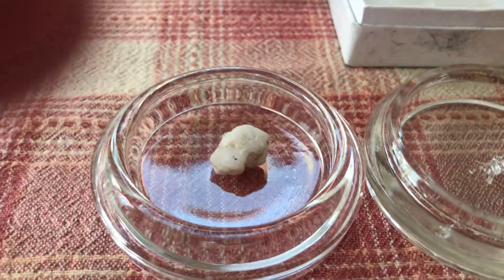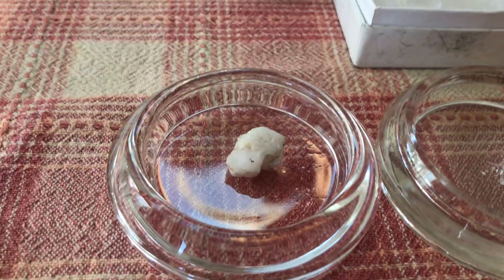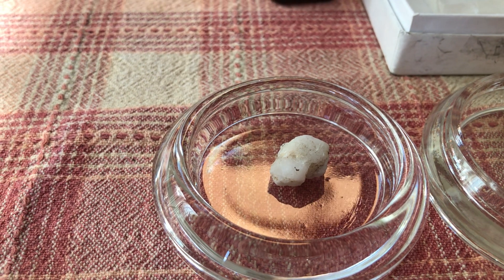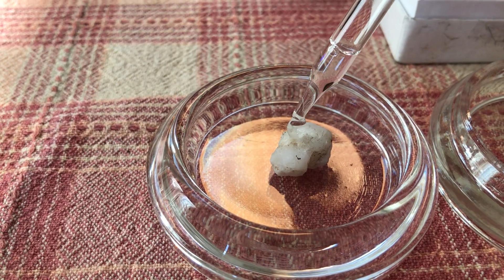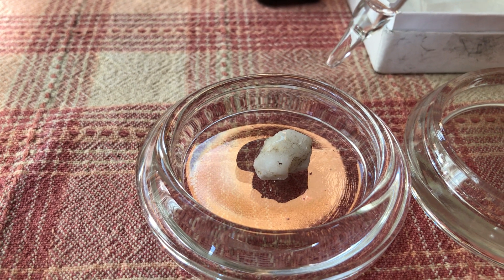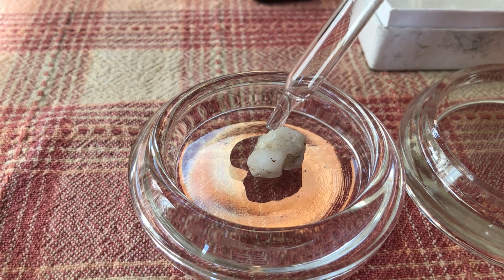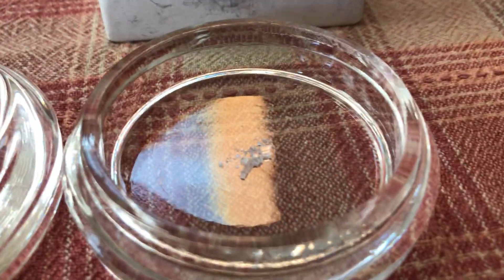So let's see what happens. We're going to start with our quartz crystal, and all we need to do is just drop a couple of drops of hydrochloric acid on it. And as you can see, nothing happens — as we should expect, quartz is not reactive with hydrochloric acid.